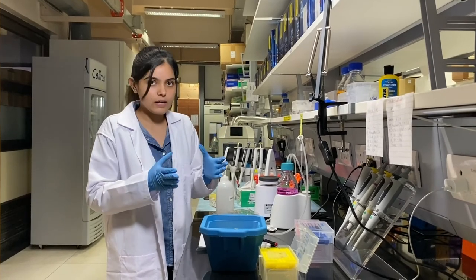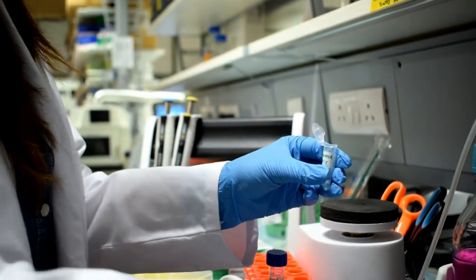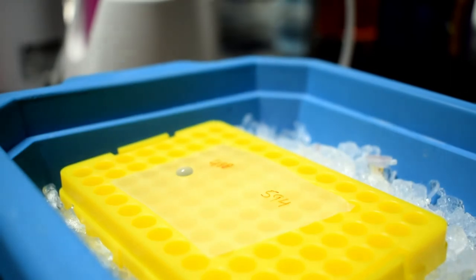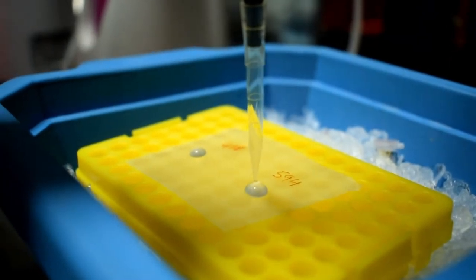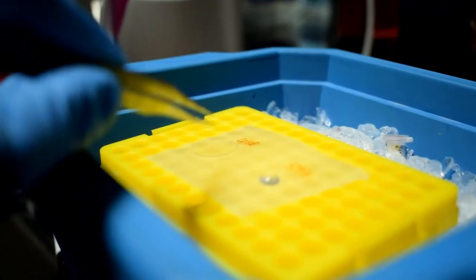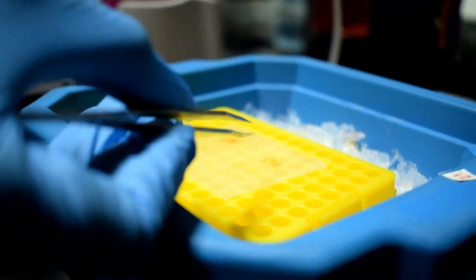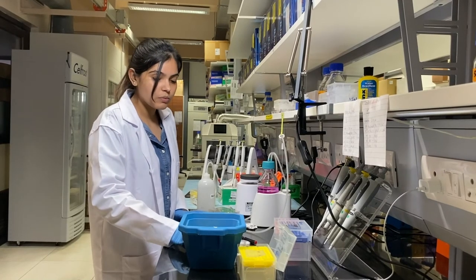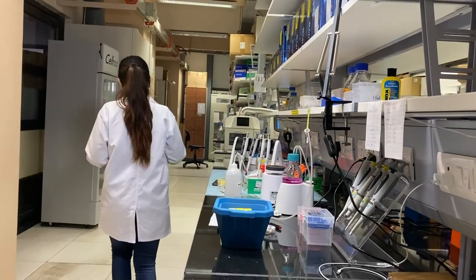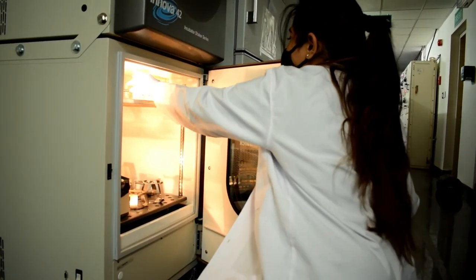In the embedding step, we embed the cells into the gel by adding them to a monomer solution and letting it polymerize and solidify around the sample. I'm adding two drops of the monomer solution here, then placing the coverslip containing my cells onto the solution. We keep this at 37 degrees for one hour to let it polymerize and solidify, embedding the cells into the gel matrix.